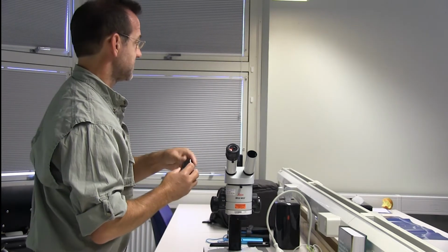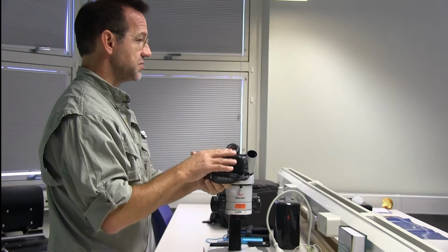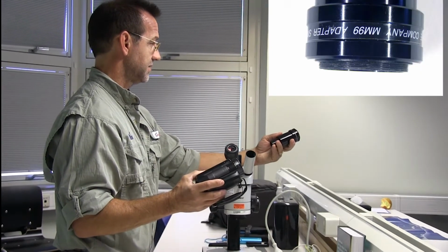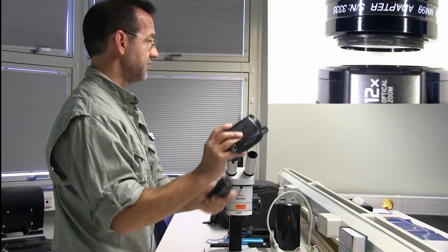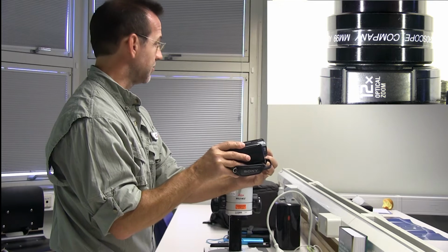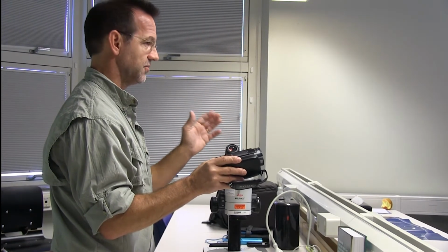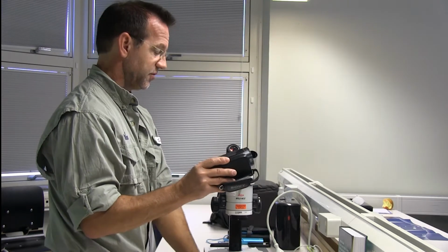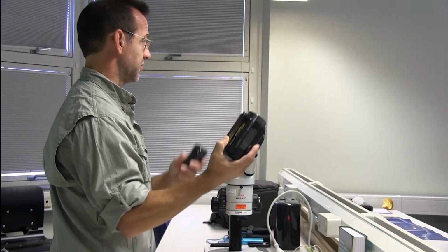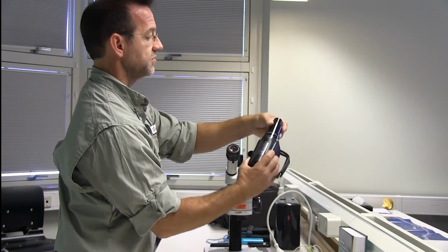And then video cameras, as you know, have gotten better and better as time has gone on here. But some things have changed about video cameras. If you're going to connect a video camera to this adapter, you'll notice it has threads on it that thread into the lens of the camera. So most of these video cameras now don't have the threads here, which is called the filter diameter. And if you're doing any photography work, or have cameras at home, Nikon or Canon or whatever, sometimes they have threads here, and sometimes they don't. So the newer cameras now don't have these threads. So you may have to look for an older camera to go with this adapter, or you rig it so that it connects together.